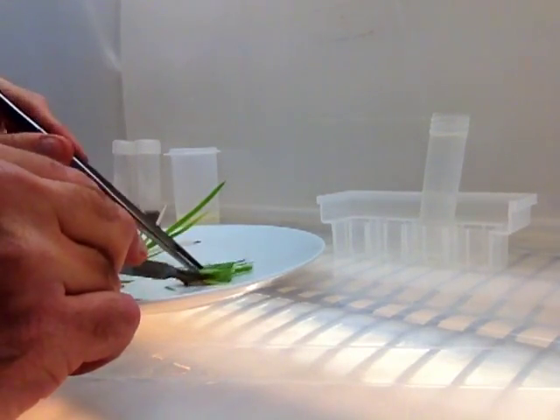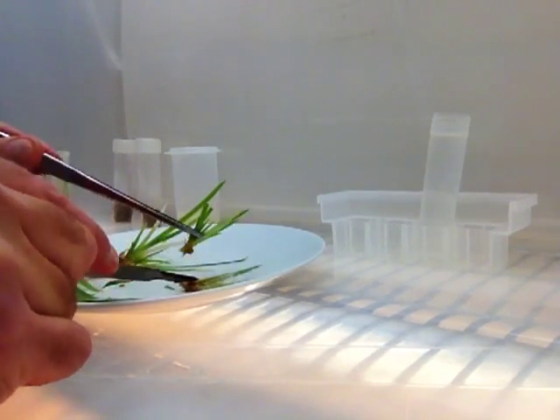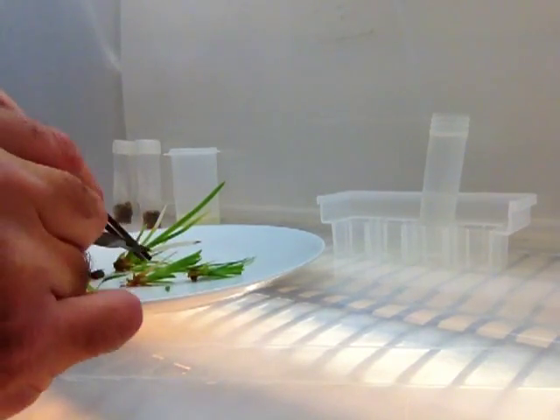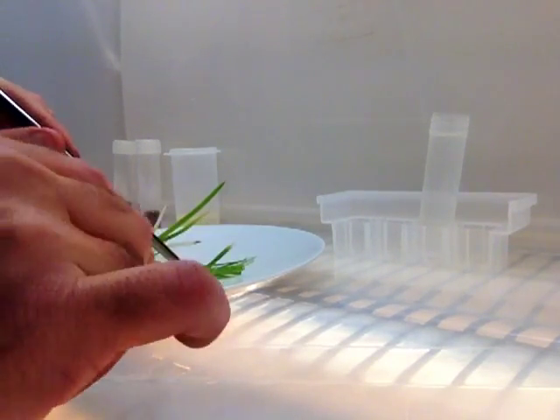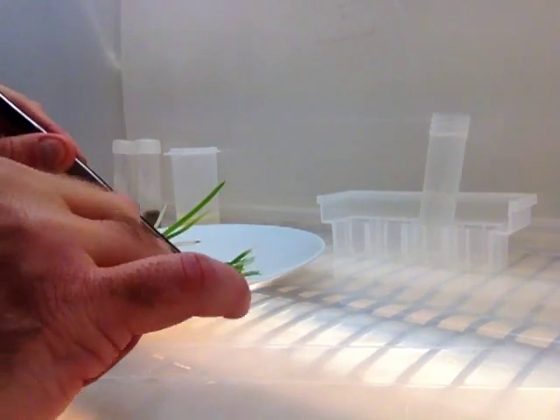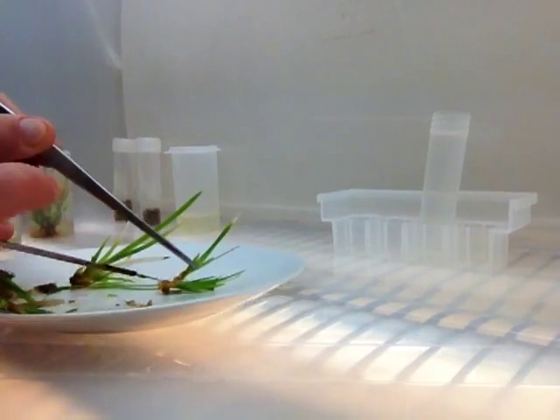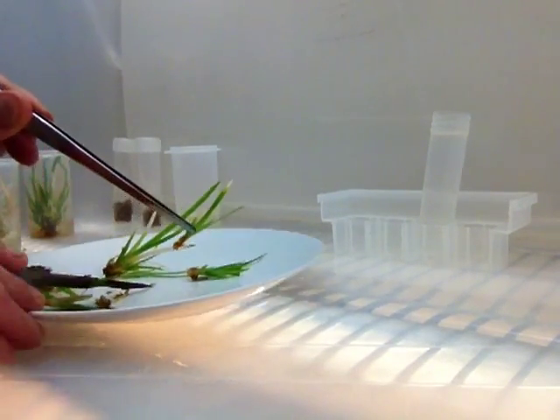You can see the places where the plants come together — use the natural splits. Little yellow leaves because the plant got too old in culture; it outgrew its nutrients. The pH probably changed a couple of points towards acidic because the plants were exchanging nutrients. Another reason I like iris: they can grow in wet and acidic environments.